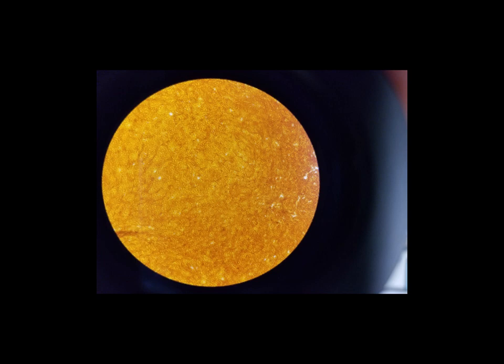And here we find just a few, we can see some nuclei scattered here and there of the fibroblasts. And then they're kind of hard to pick out, but we see some fibers here, and these are reticular fibers. And those reticular fibers really are what are providing that framework.